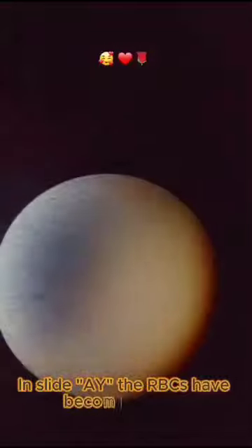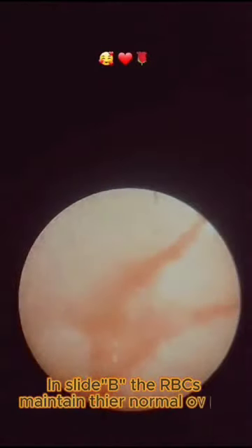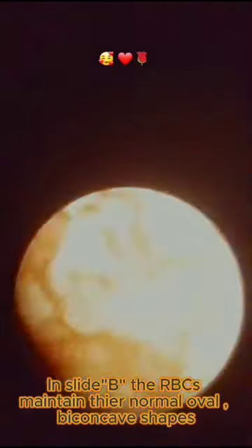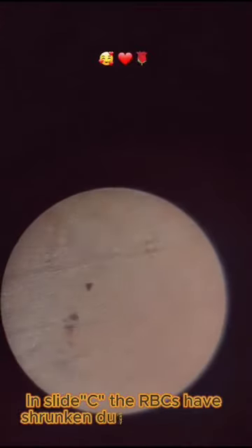Now observe the result. In slide A, the RBCs have become swollen due to hemolysis. In slide B, the RBCs maintain their normal oval, biconcave shapes. In slide C, the RBCs have shrunken due to exosmosis.